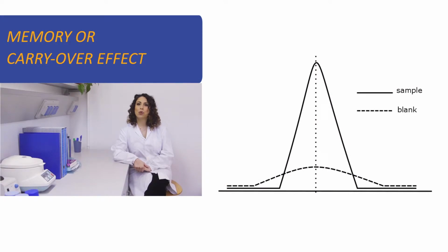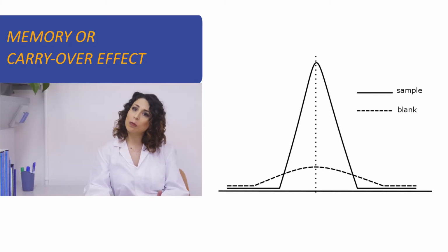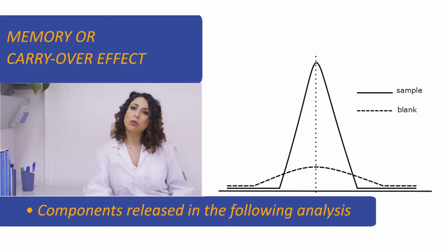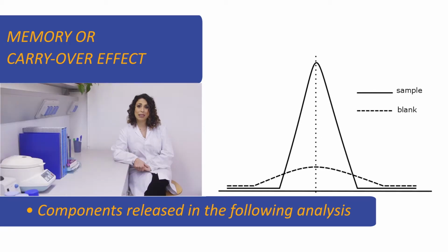We will have a memory or carryover effect, when the components of a previous analysis appear in the new chromatogram. This is possible due to components adhering to the tubes, connections and column materials that are being released in the following analysis. Luckily, modern instruments have a very low carryover.